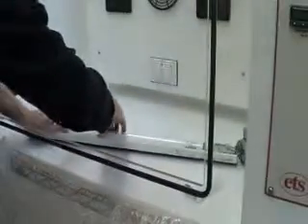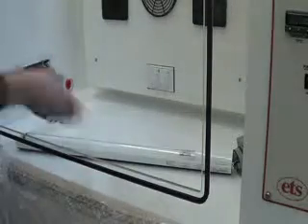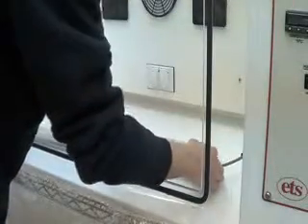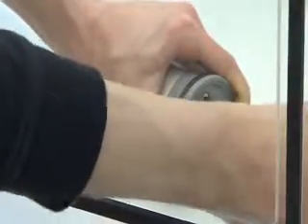To reinstall, there are little slots on top — align the two pins vertically with the slots, stick it in, and twist until it locks. Then put the plate back on and slide the tube back on carefully, not scratching it. Line it back up — usually you want a flat surface to get it seated well. Then go around and tighten the screws to compress the O-ring again. As you tighten it, you'll see the rubber O-ring get squished in, and that seals off the light.